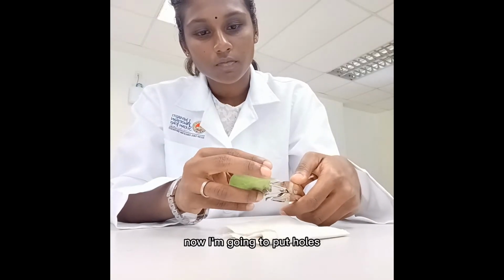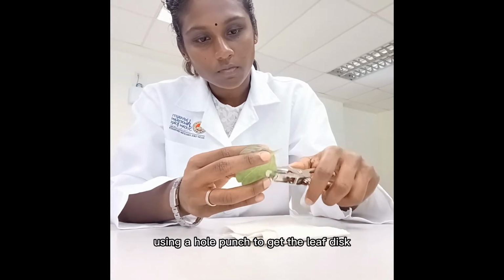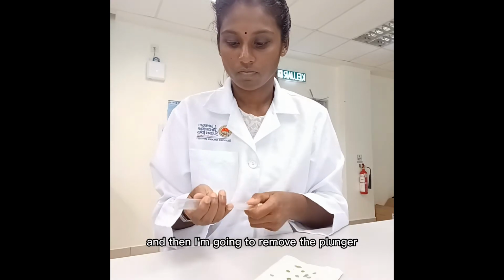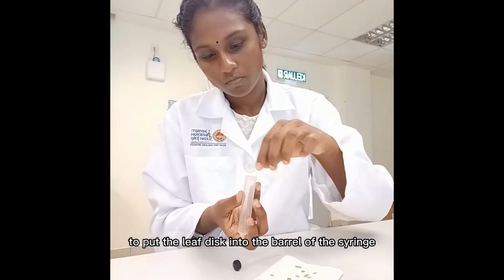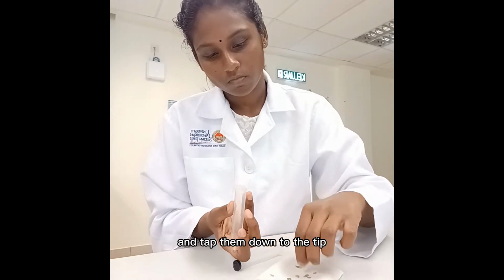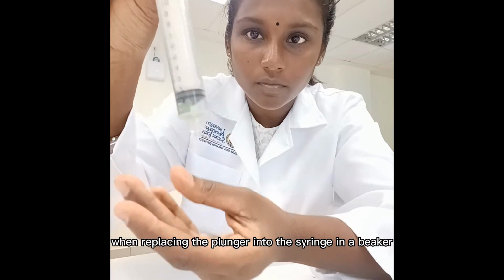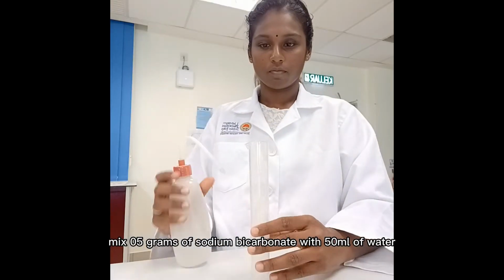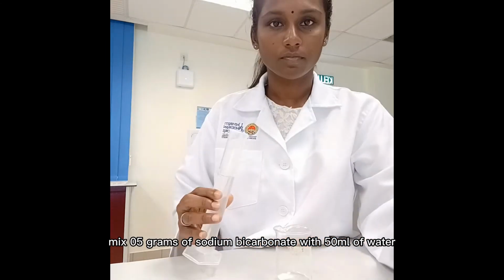Now I'm going to make holes using a hole punch to get the leaf discs. And then I'm going to remove the plunger from the syringe to put the leaf discs into the barrel of the syringe and tap them down to the tip without damaging the leaf discs when replacing the plunger into the syringe. In a beaker, mix 0.5 grams of sodium bicarbonate with 50 ml of water.